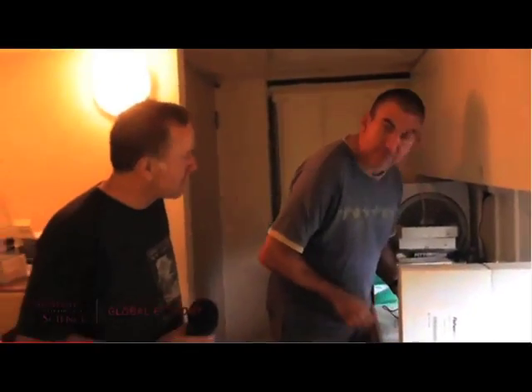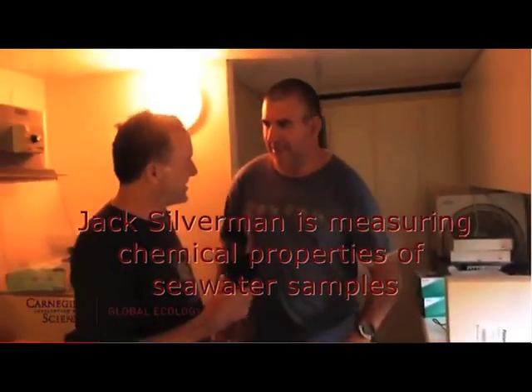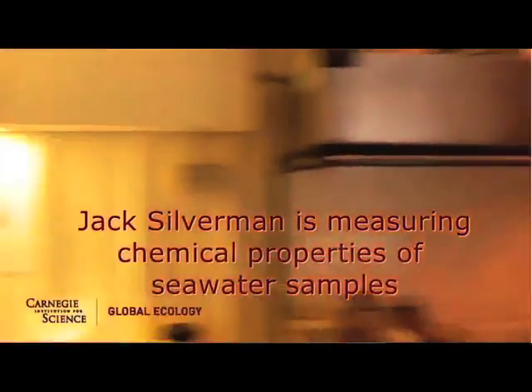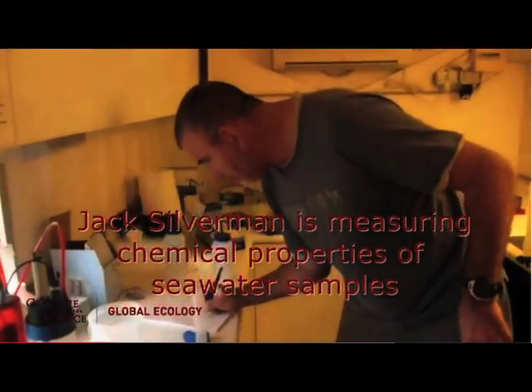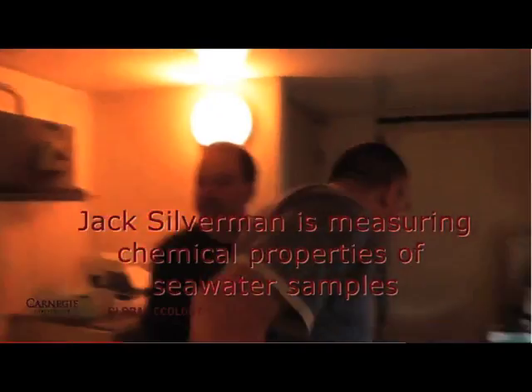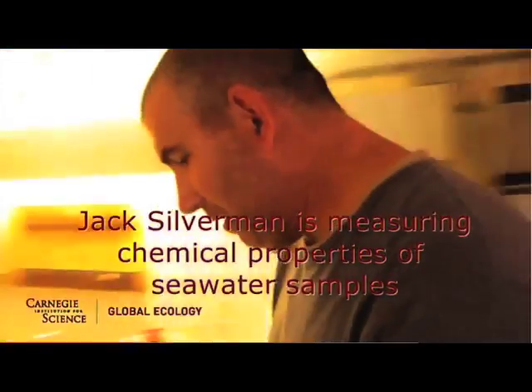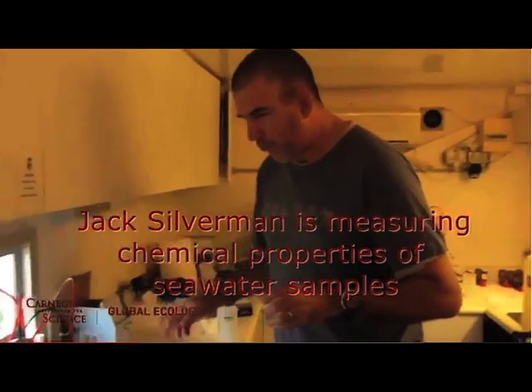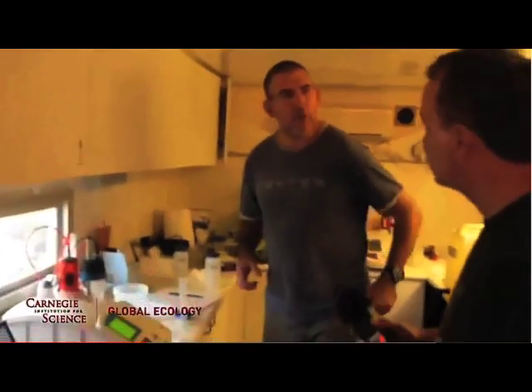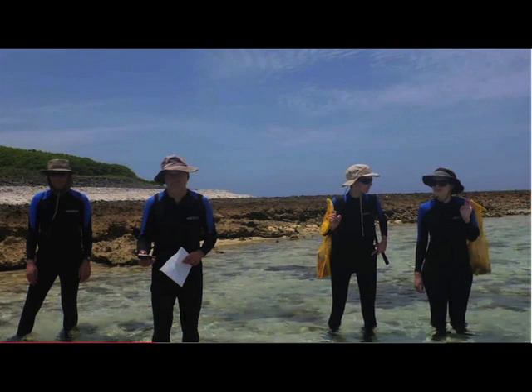This is Jack Silverman from IOLR, the Israeli Institute of Limnology and Oceanography. He is analyzing seawater sampled earlier on the reef flat for total alkalinity.